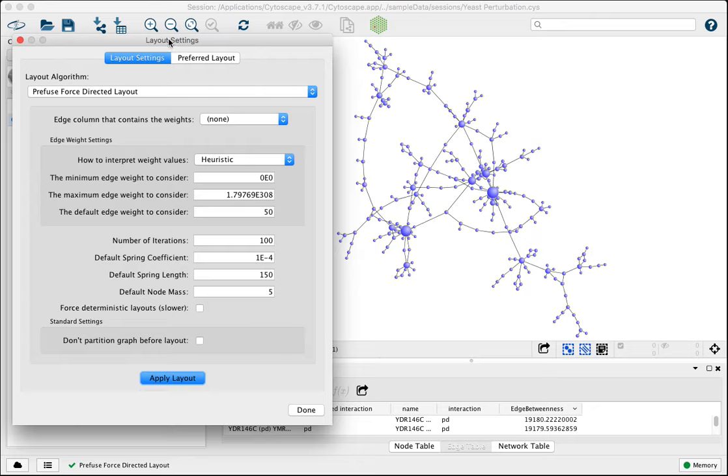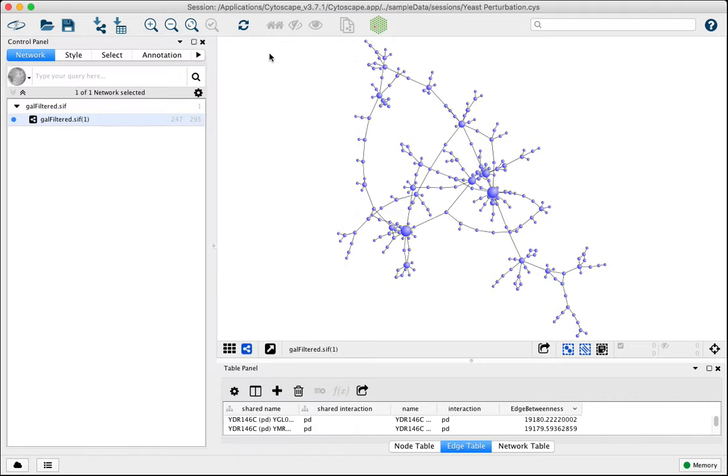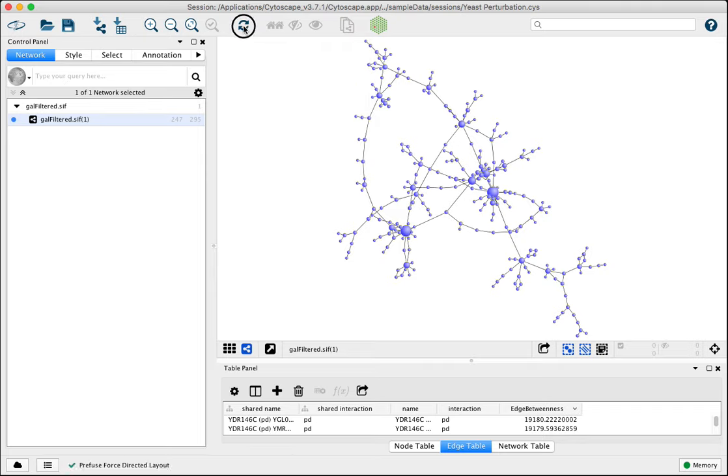This is also the same interface where you can set which layout you want to be your preferred layout. If we set it to Prefuse force-directed, and click done, that then encodes what this layout repeat icon will do. So you can just click this in the future and it'll perform your preferred layout with the last set of parameters that you chose.